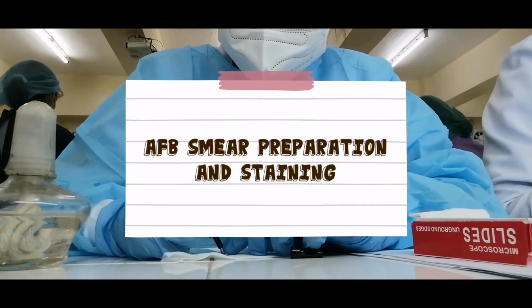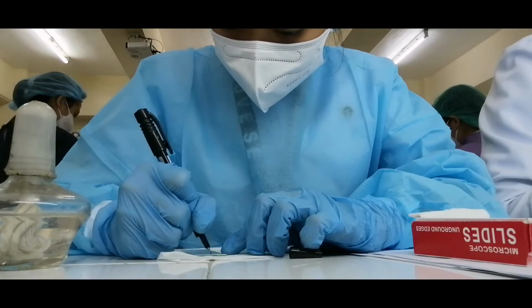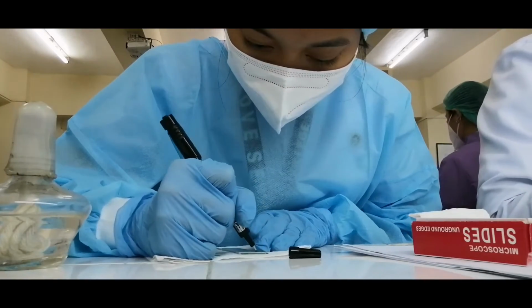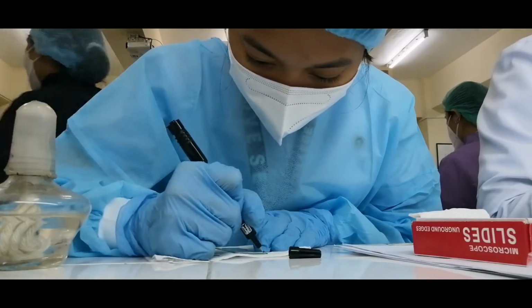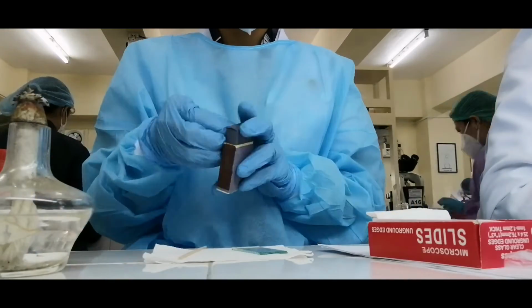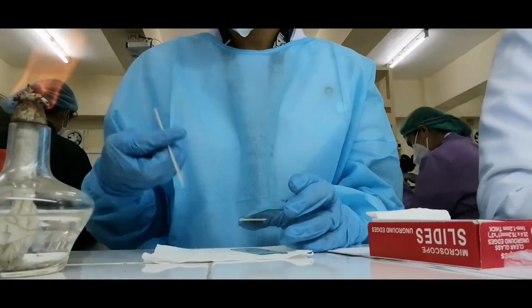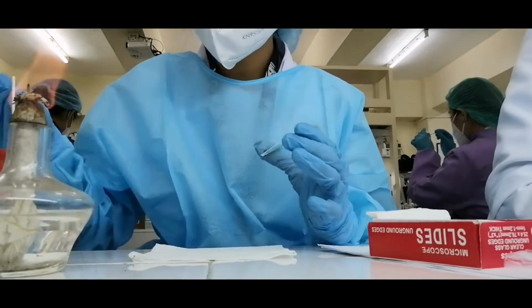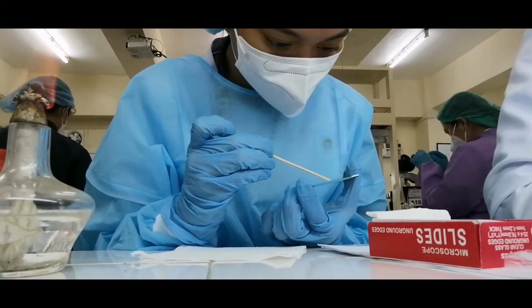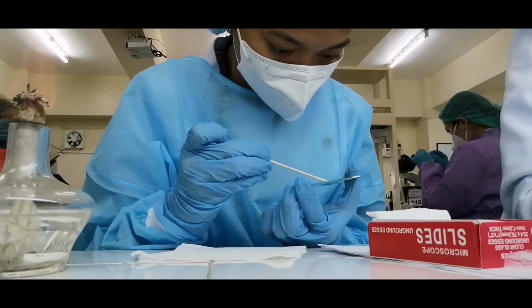AFB smear preparation and staining. Prepare a clean glass slide and label the specimen number at the frosted end of the slide. To make a sputum smear, fish out 1 loopful of yellowish particle of sputum and spread evenly on the slide with an applicator stick.